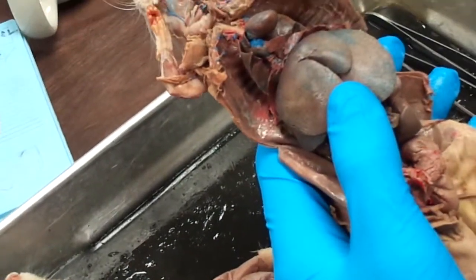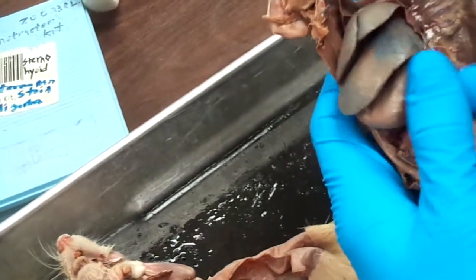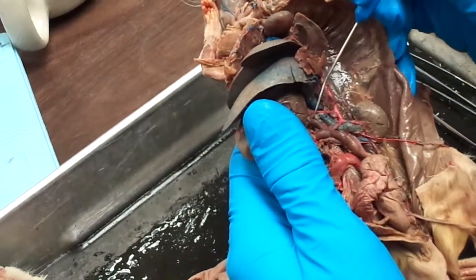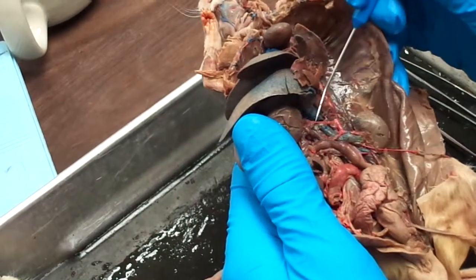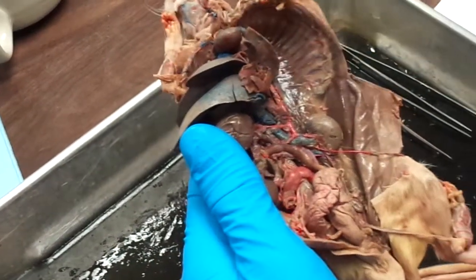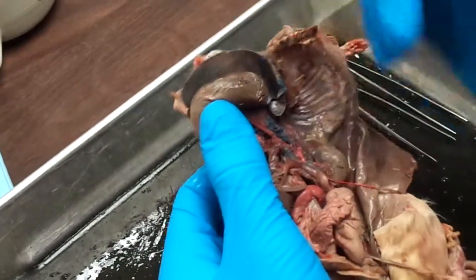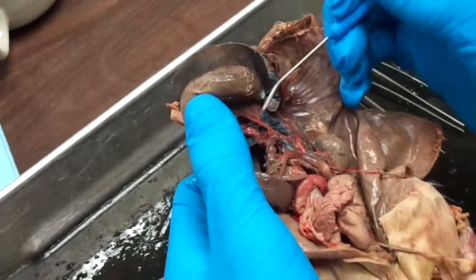Continue down, the next one you're going to find is the celiac artery, which will be pinned close to the descending aorta if it is, because it only spans out to here. This is all celiac artery, and it's going to split into three different ones. The first one is the gastric artery, comes right up here to the stomach.